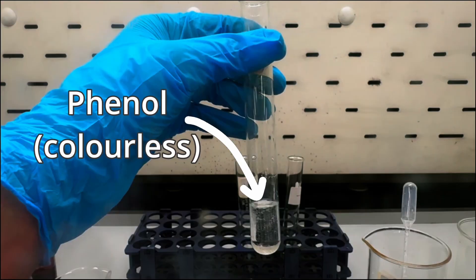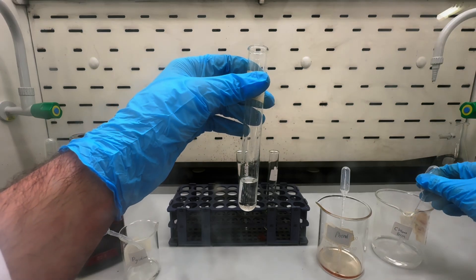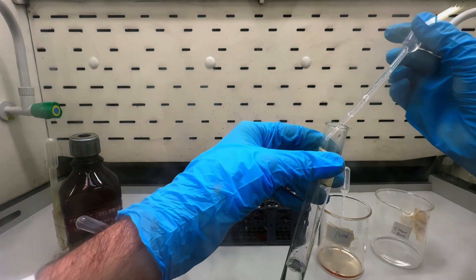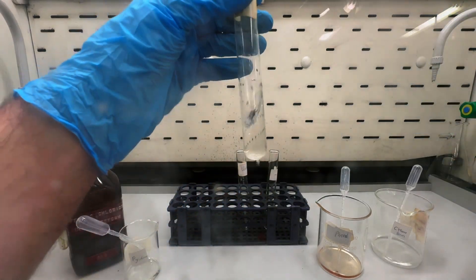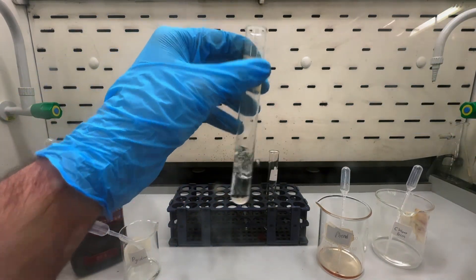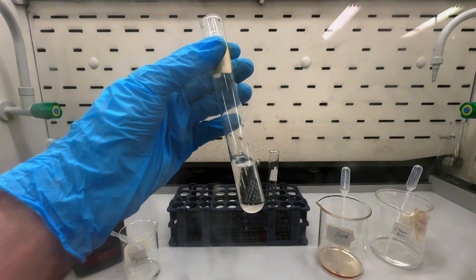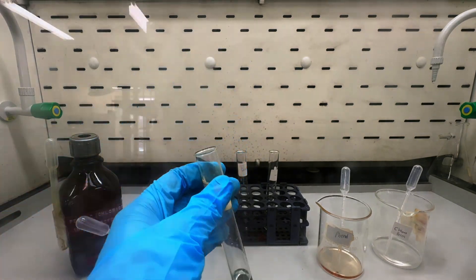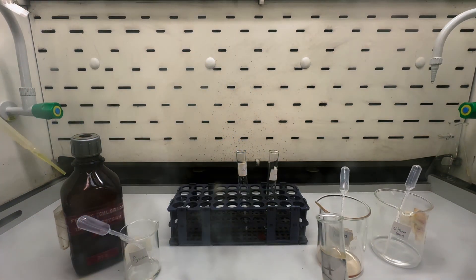I already have a test tube preloaded with phenol, a colorless liquid, to which I'm adding a sufficient amount of chloroform ranging from 2 to 5 milliliters, mainly to get the phenol into solution, followed by a few drops of the ferric chloride reagent.